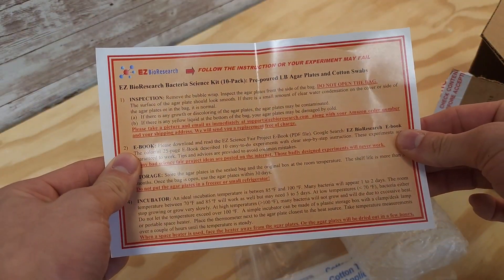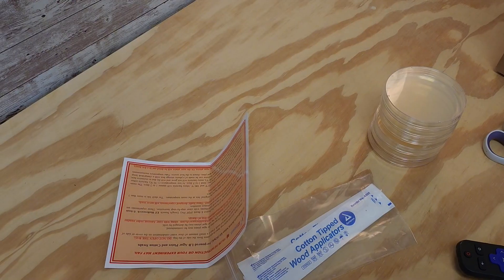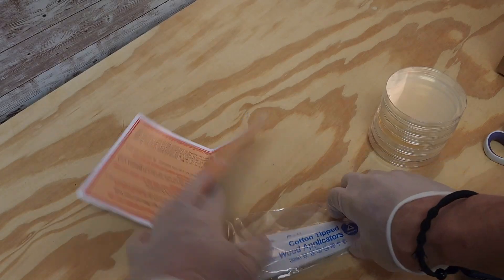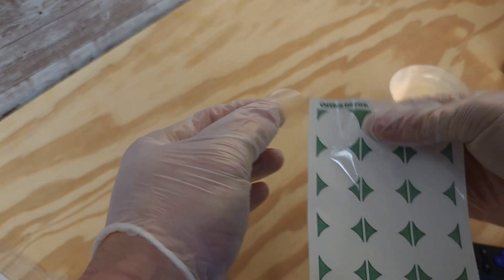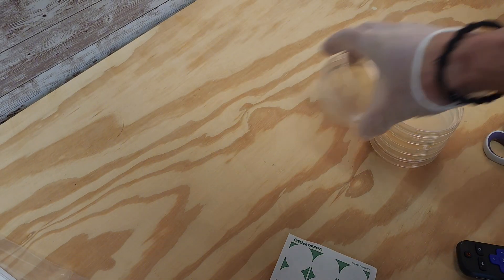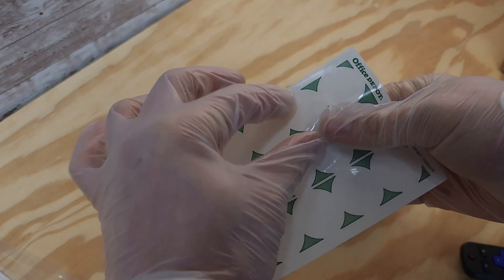For those who don't climb, I'm also going to swab a barbell to compare a piece of gym equipment to a toilet and climbing holds — to see which one is the grossest. People often clean the gym equipment; you're supposed to wipe things down like a barbell or dumbbells after you're done, but sometimes you just forget and get into the rhythm of a workout and don't wipe it down, and that's normal.